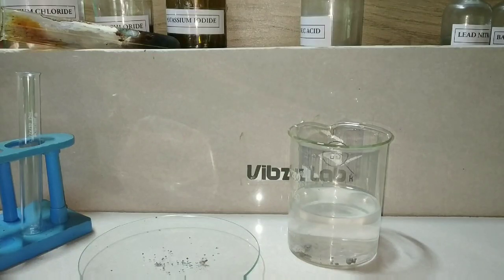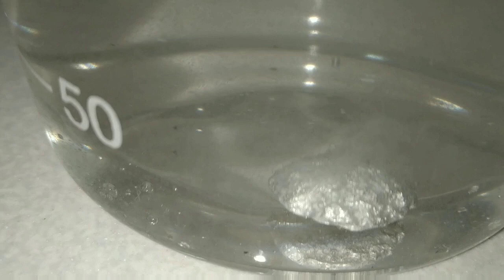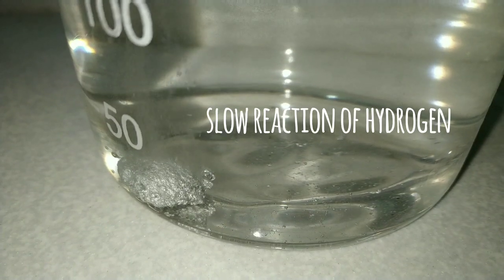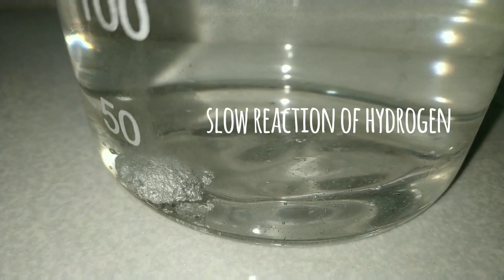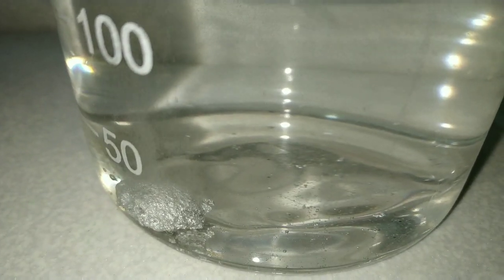You can see that on adding the sodium amalgam, initially there was a vigorous reaction due to unreacted sodium which was covering the amalgam. Later you can see a steady reaction is going on and hydrogen gas is slowly liberated.